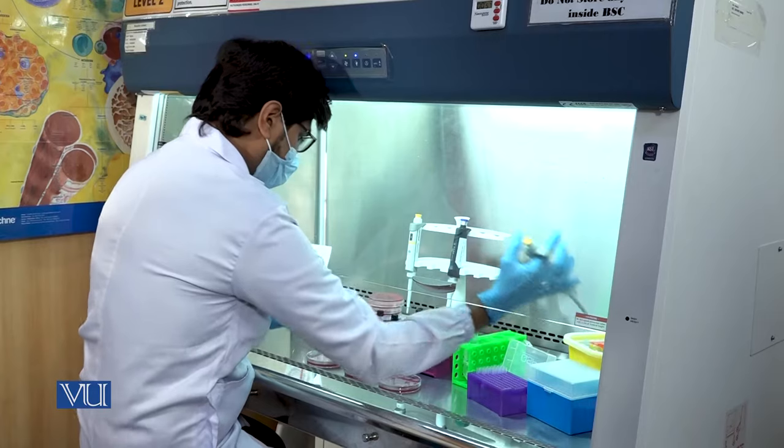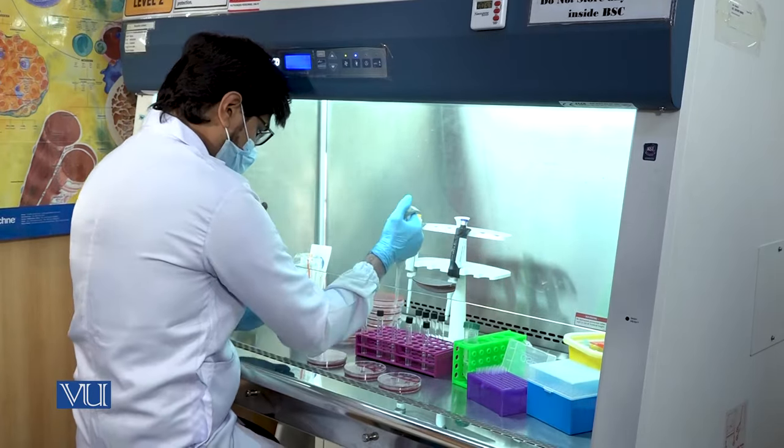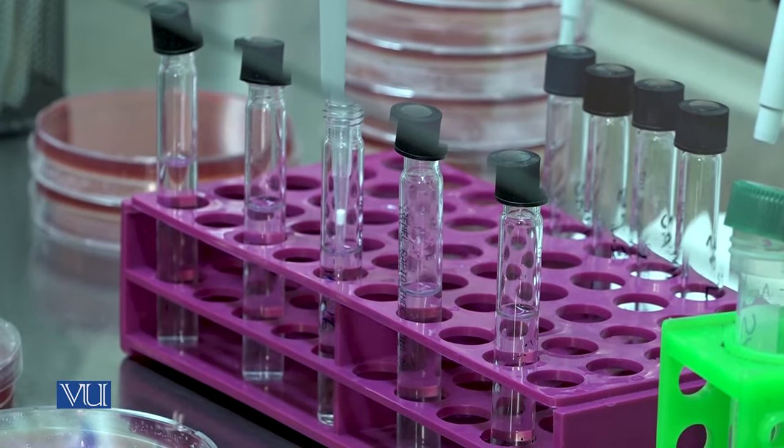Add it into the third culture media petri plate and discard the pipette tip. Pick solution from the third dilution test tube.